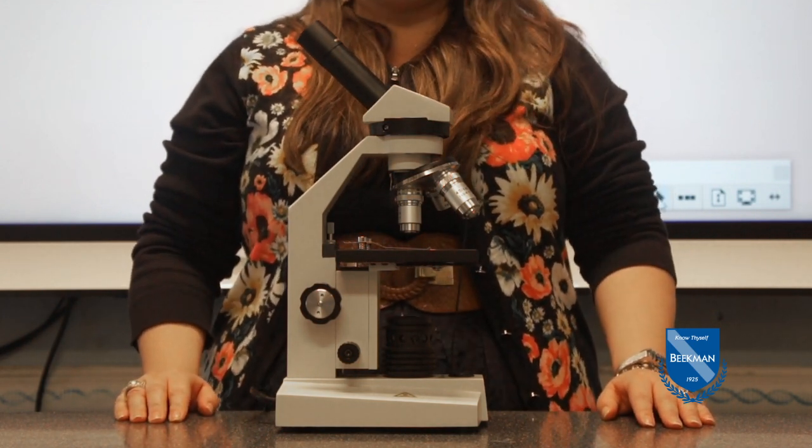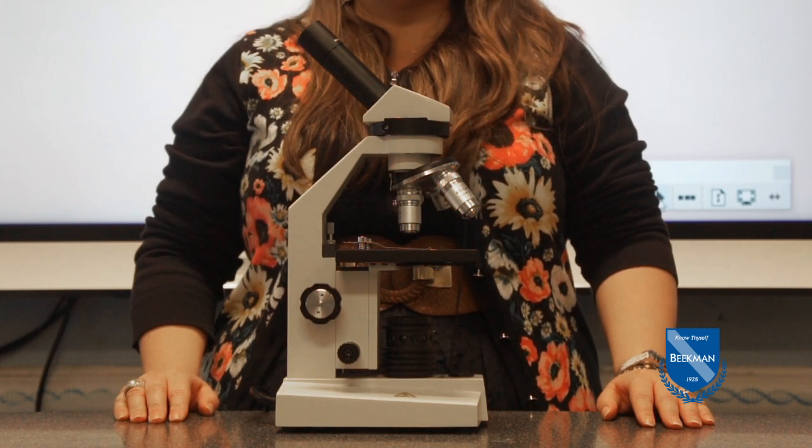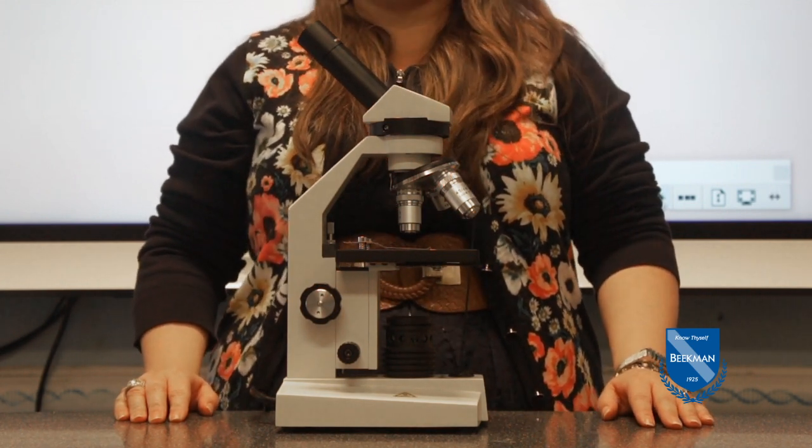I'll point to each piece on the microscope, give you a few seconds to respond, and then I'll tell you the right answer.